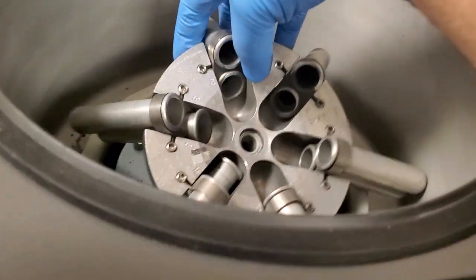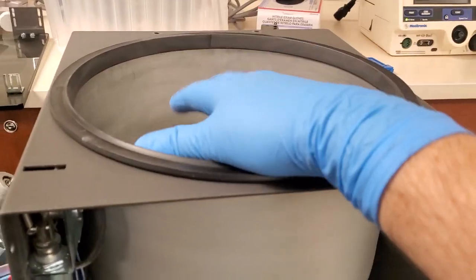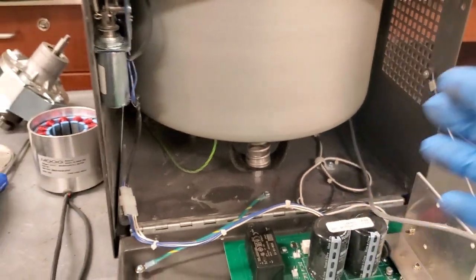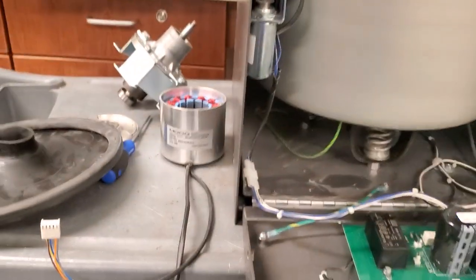And inside these test tubes, you can see that there's debris and stuff inside the test tubes. So without having a balance sensor, and with these having so many moving parts, it's so easy for this to be out of balance. And if it gets up to a certain RPM, it'll just kind of power through because there is no vibration detect on it.